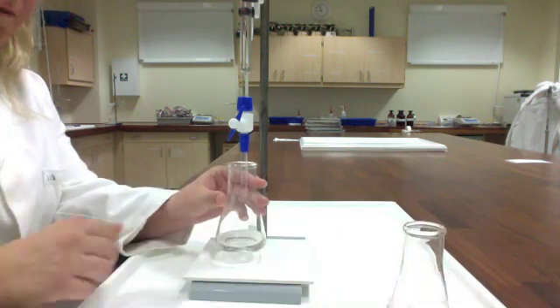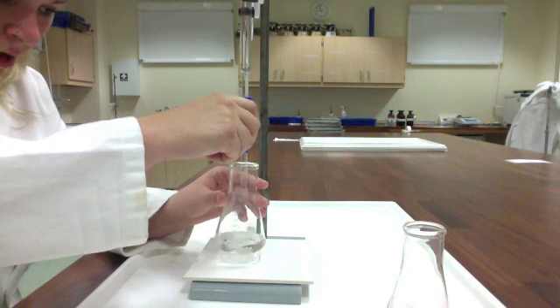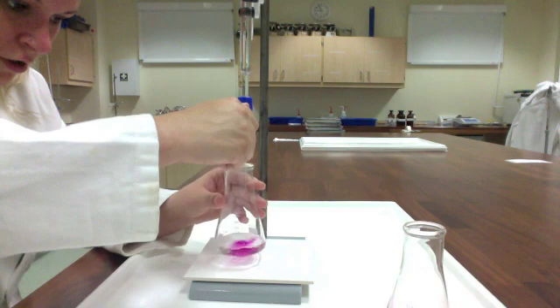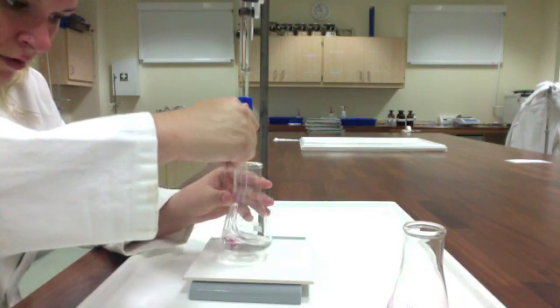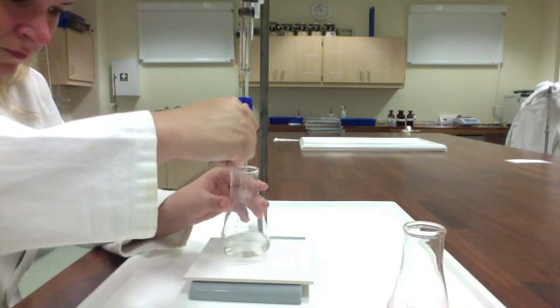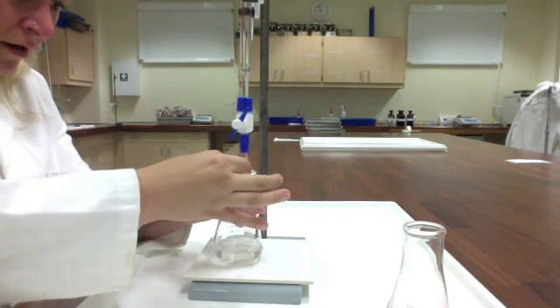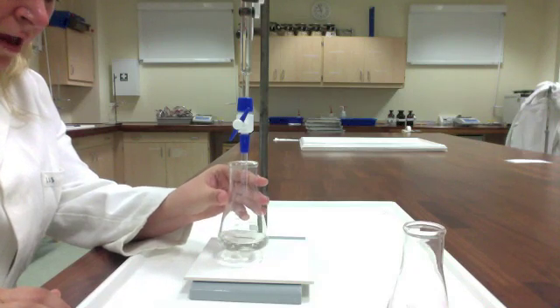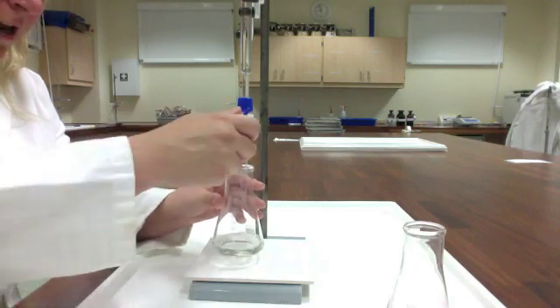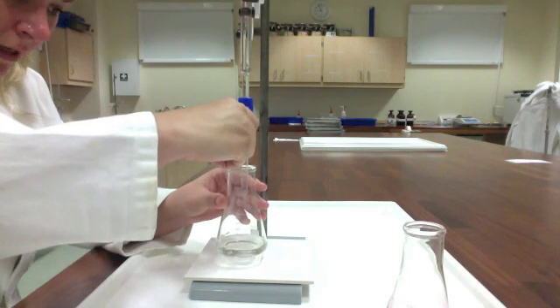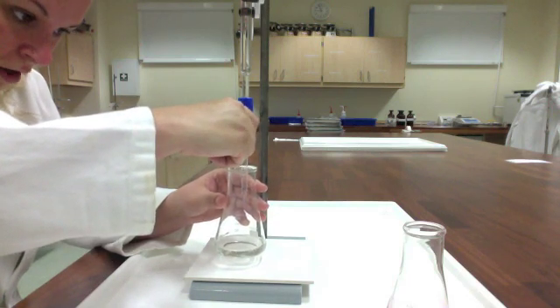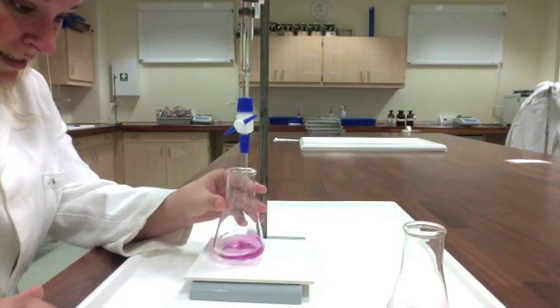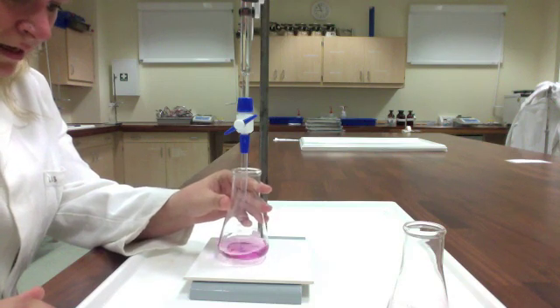So I'm just going to move this one out of my way so that it's not kind of skewing what I'm seeing. And again, just really making sure that I add, do my best to add a drop at a time. Sometimes we get a drop hanging off the end of the burette. So you just got to make sure that you flick it in. I'm, this is really close. I can tell here. So I want to make sure I'm really careful about adding a drop at a time. Is this it? Is this it? Yes, it is.